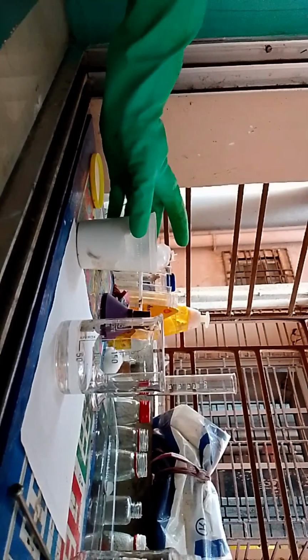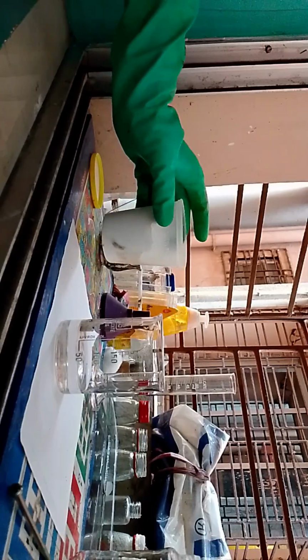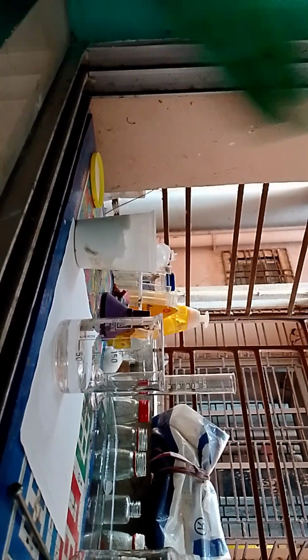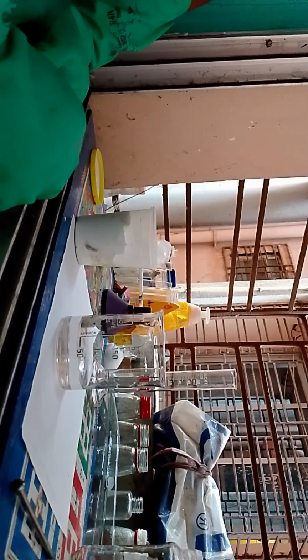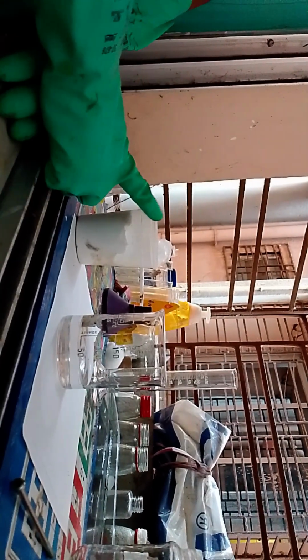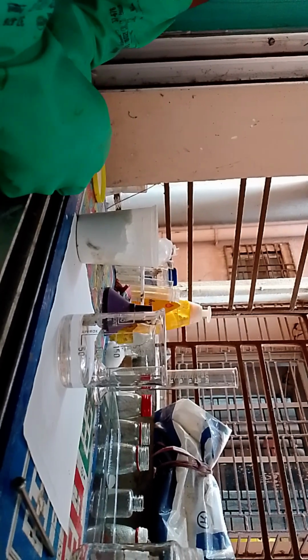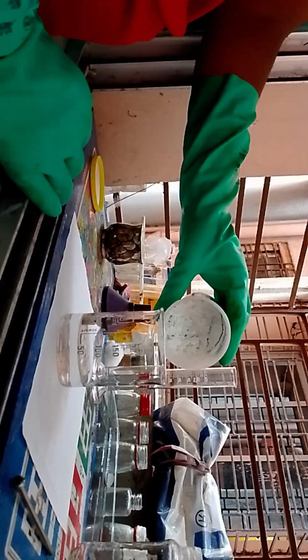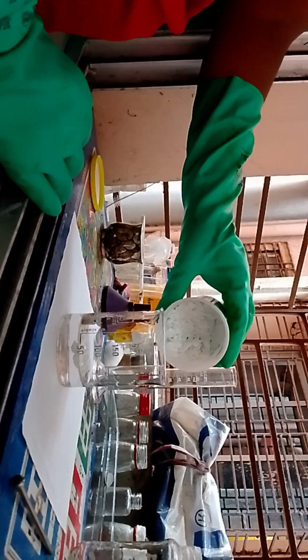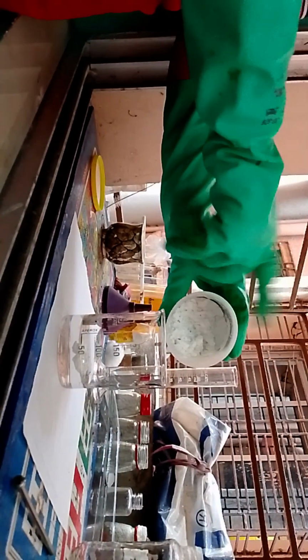But calcium chlorohypochlorite, because a lot of air pores are in there, will float. Also, there may be generation of a little bit of chlorine because it continuously reacts with air and moisture to form chlorine gas. Okay, now we are going to dump in quite a lot. It's soluble in water but in very small proportions, so I don't think much will dissolve.